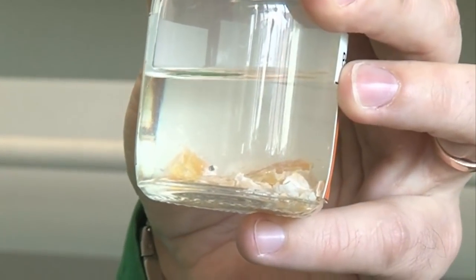And straight away you can see that the splint does relight. So we know that there's not very much nitrogen in that flask, so we can probably do our reaction with phosphorus in the quickest possible way. So here's the white phosphorus, the P4.